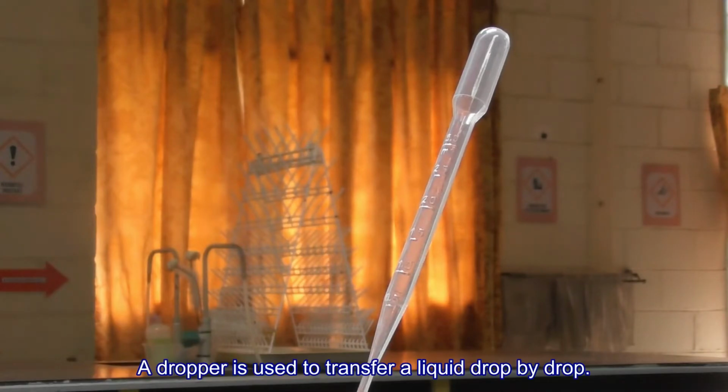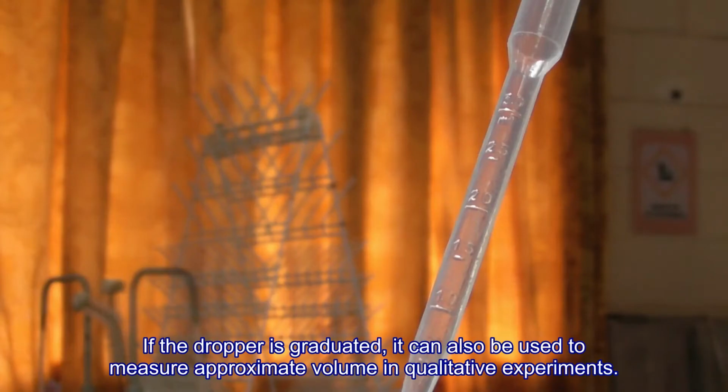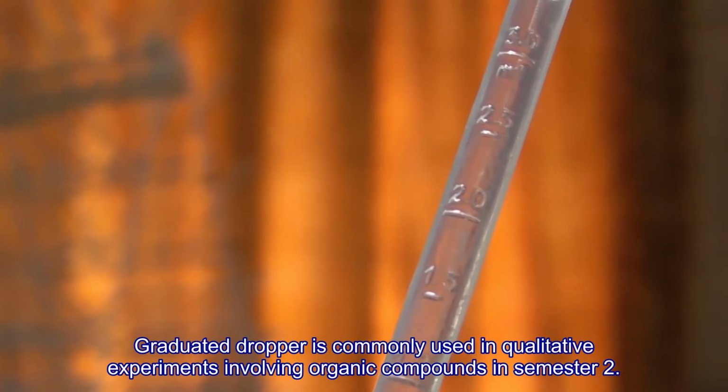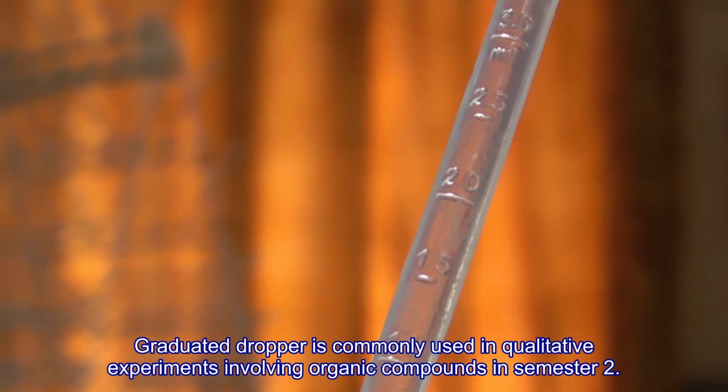A dropper is used to transfer a liquid drop by drop. If the dropper is graduated, it can also be used to measure approximate volume in qualitative experiments. Graduated dropper is commonly used in qualitative experiments involving organic compounds in semester 2.